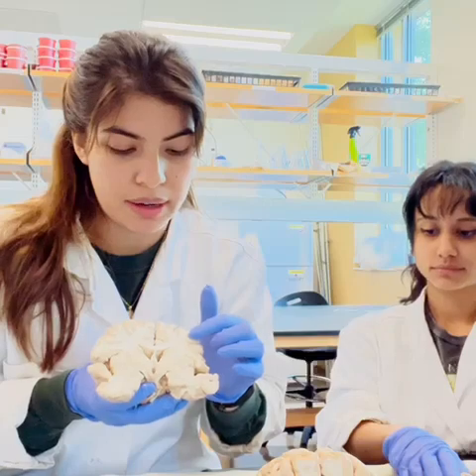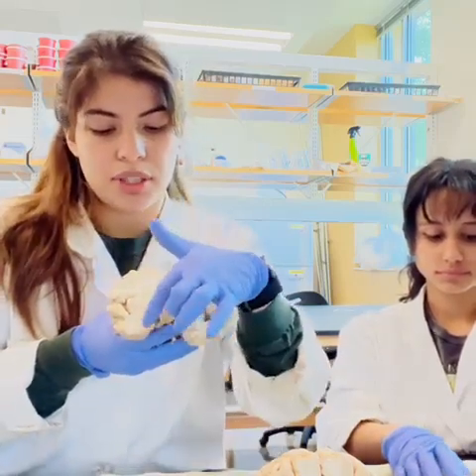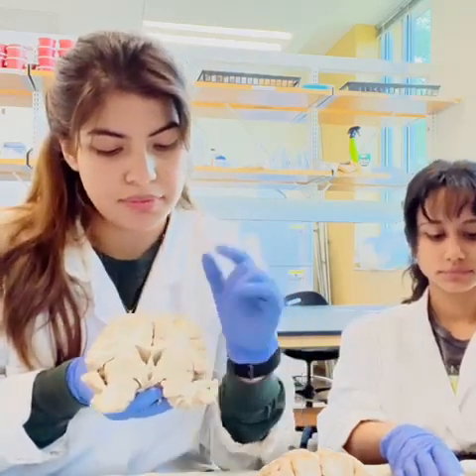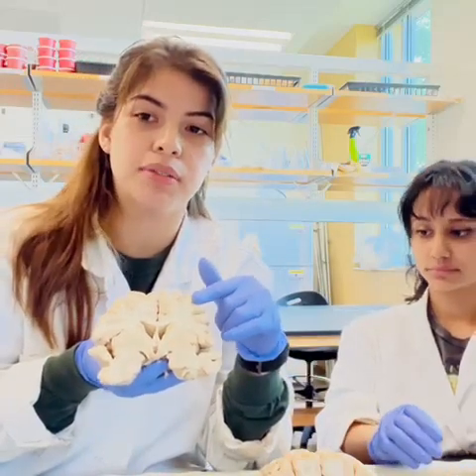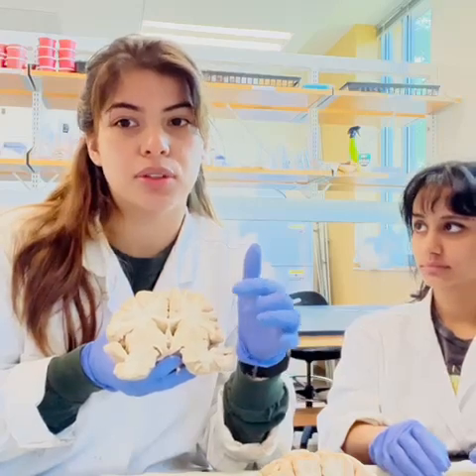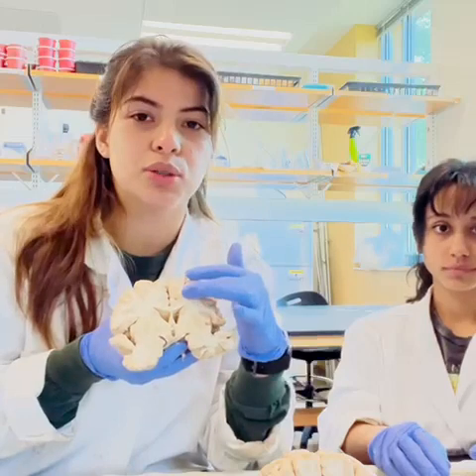Then when we open up the brain, we can see it divided into the white and the gray matter. The gray matter is on the outer portion and the white matter is on the inner portion. Looks kind of like a butterfly. The gray matter is made up of the cell bodies of neurons, while the white matter is made up of the bundle of axons of neuronal cell bodies present in the gray matter area. So these two are connected.